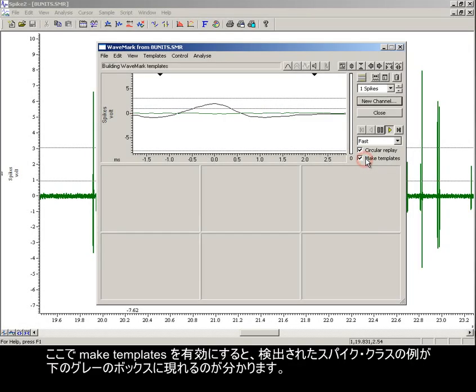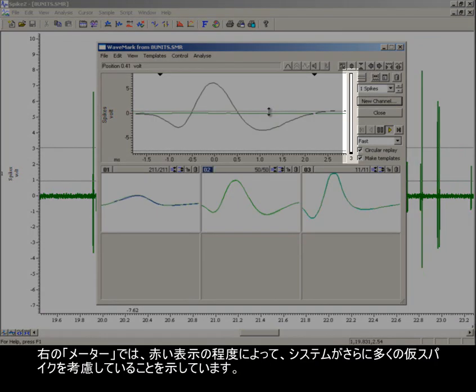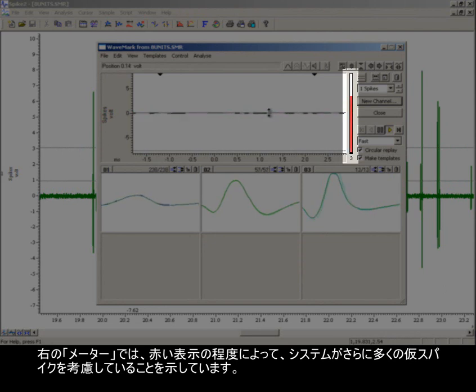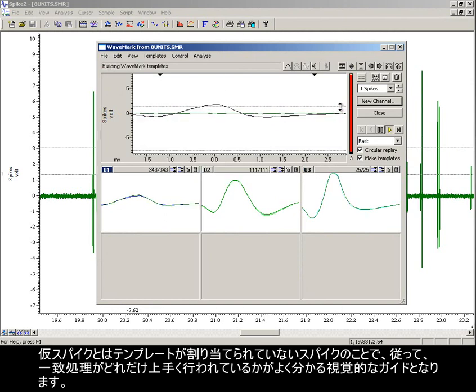Enabling Make Templates now, and you can see the lower grey boxes populated with examples of spike classes that have been detected. Dragging the upper trigger towards the baseline, I can force more events to trigger. The meter on the right shows a degree of red, indicating that the system is considering many more provisional spikes. These are spikes which have not been allocated a template, and therefore it is a good visual guide to how well the matching is performing.